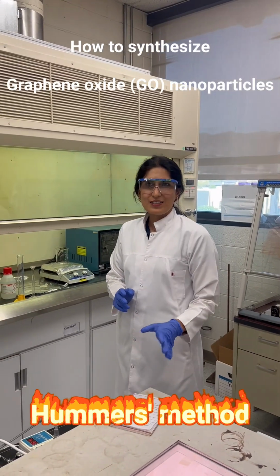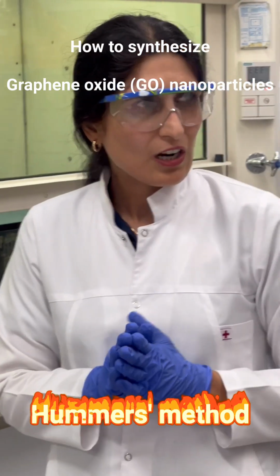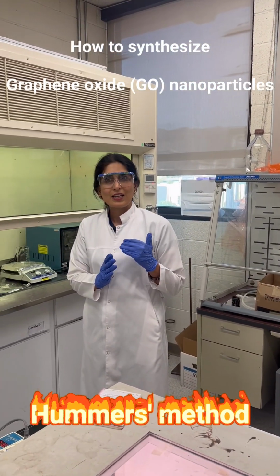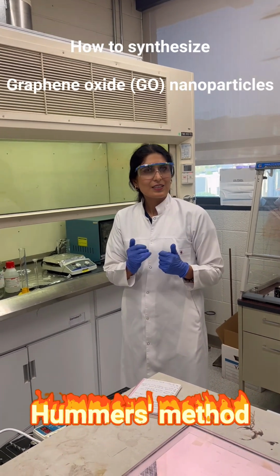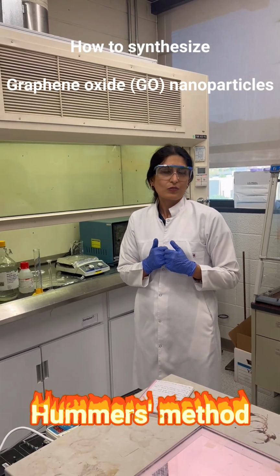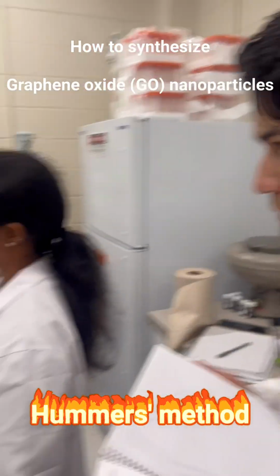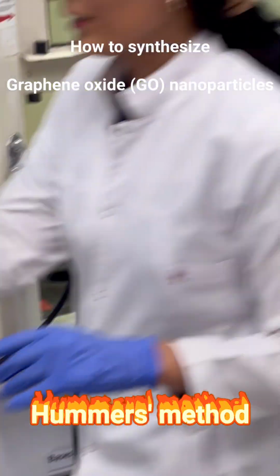First, for synthesizing graphite oxide, we prepared this modified Hummers method, and we mix phosphoric acid and sulfuric acid. 9 ratio of sulfuric acid and 1 ratio of phosphoric acid. We start with a low amount, and at the beginning I'm going to mix in 1 beaker first.